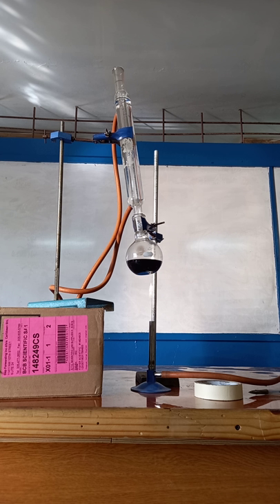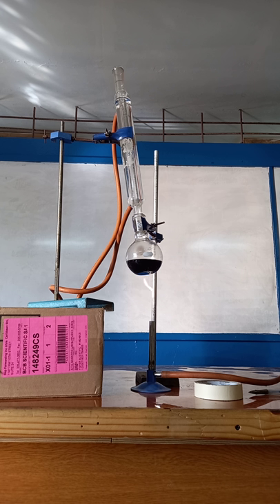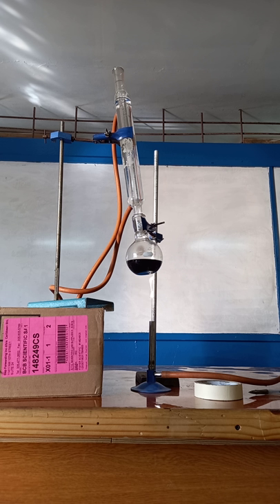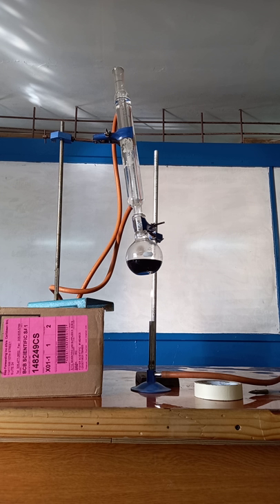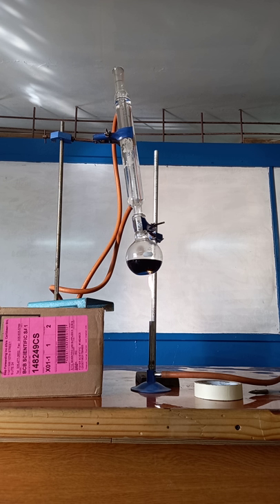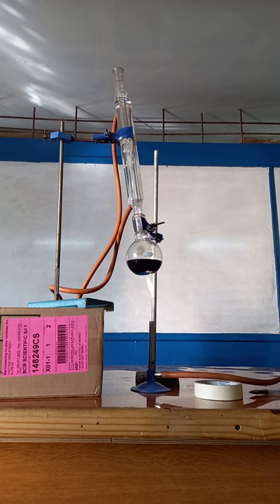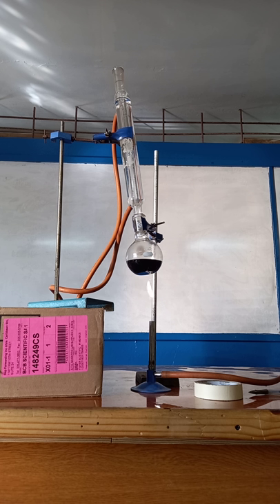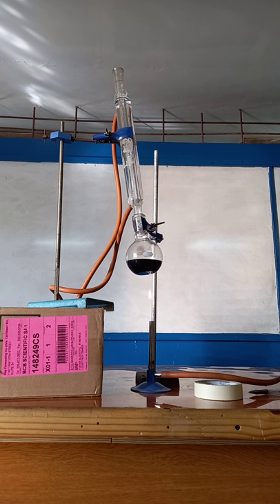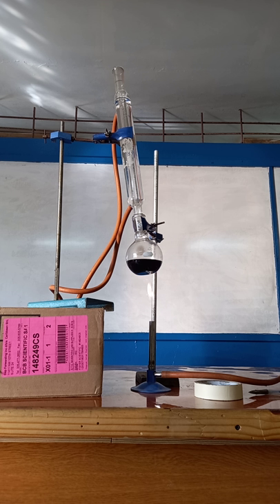With reflux, nothing is able to escape from the reaction mixture. Remember earlier with distillation, when the aldehyde vaporized we condensed it and collected it. In this one, when it condenses it falls back into the reaction mixture, which means all of our aldehyde will be converted to carboxylic acid.